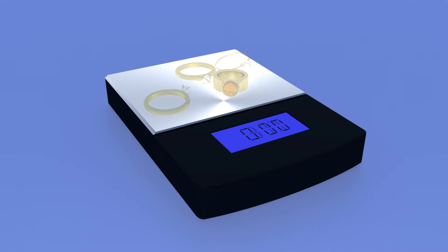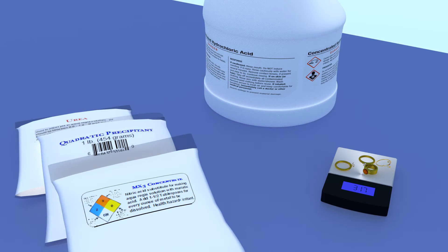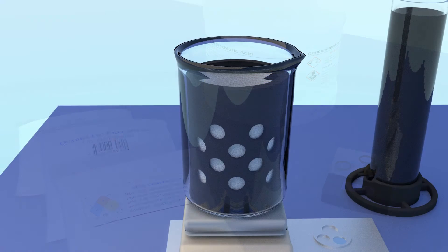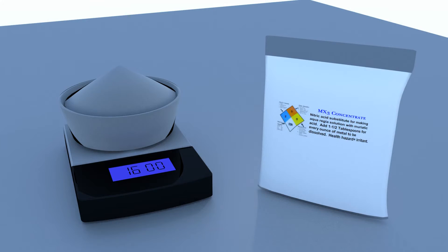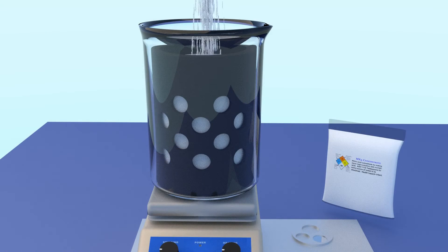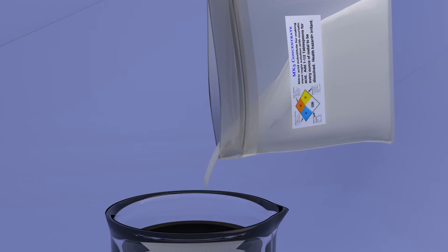The first step is to weigh your metal. This weight will determine the quantities of chemicals required to refine it. Add your gold to the basket, weigh an equal weight of MX3, and then add the MX3 to the basket.